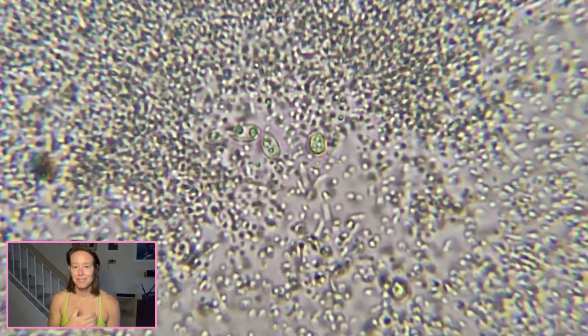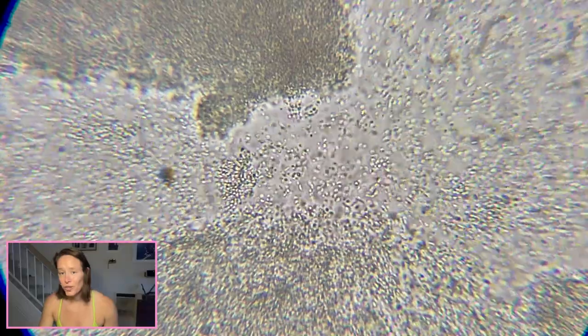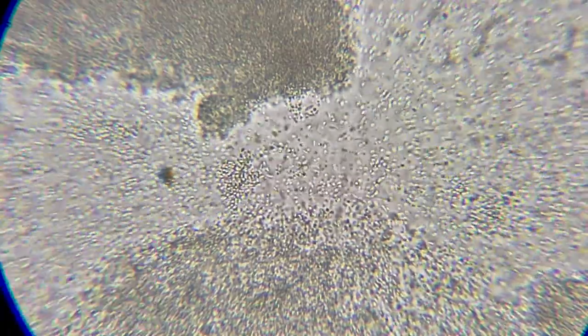You can also see some yeast here, and those are also probably Saccharomyces cerevisiae. There's a lot of really fun channels in here too, where the bacteria are just flowing in really fun ways. So please enjoy these time lapses that I've created of various channels.